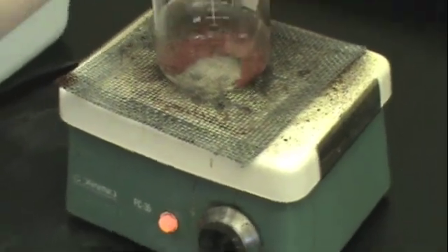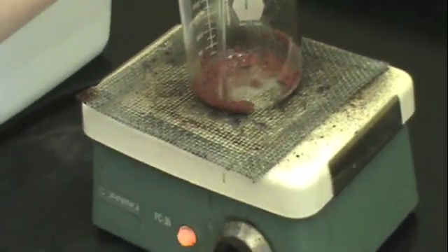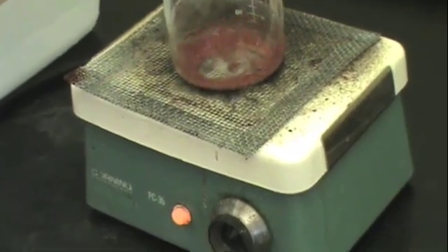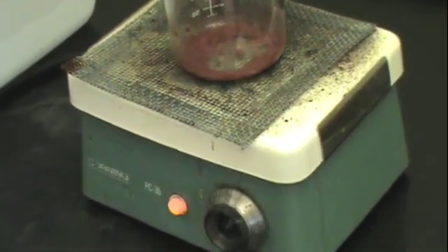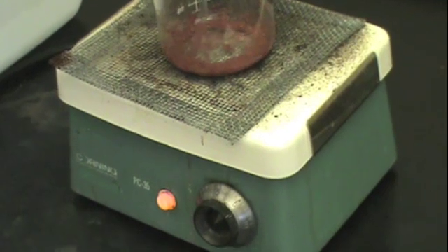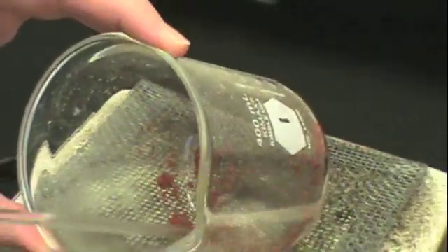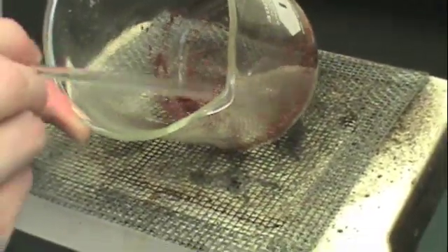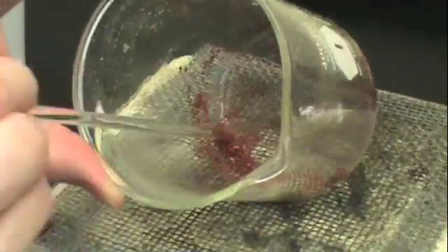Now take your beaker over to the hot plate and use your stir rod to agitate the solid. This will help remove any moisture or excess acetone from the solid. Continue to agitate until your copper precipitate becomes a fine powder. This may take several minutes.